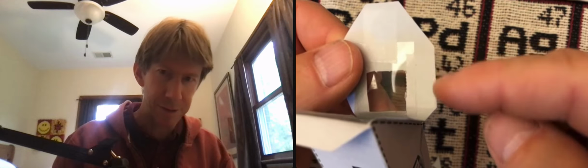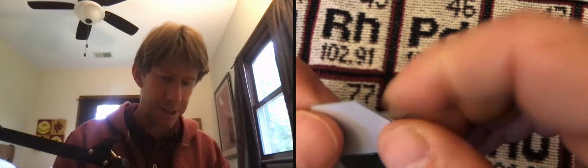And my tape sticks out a little bit past this edge. I can cut that off too if it sticks out too much. All right. So I've got tape on both sides. I'm now going to tape here, here, and here so that it will be flat. And I want to get that so that there's as little light as possible going into it.